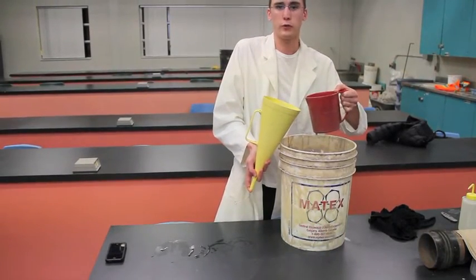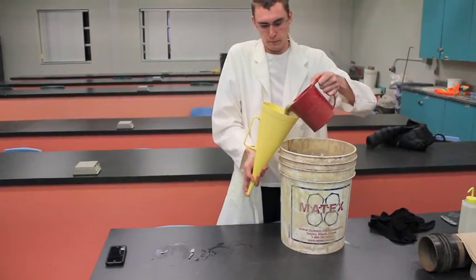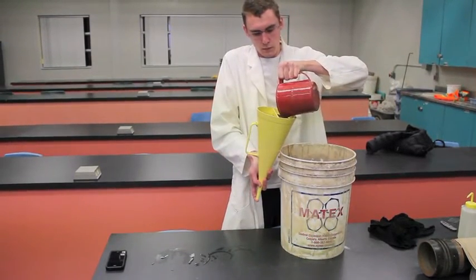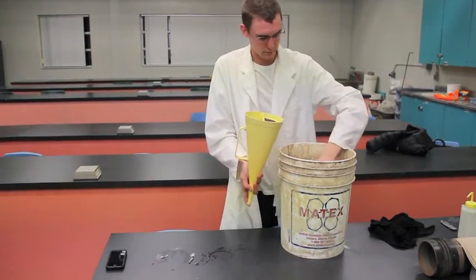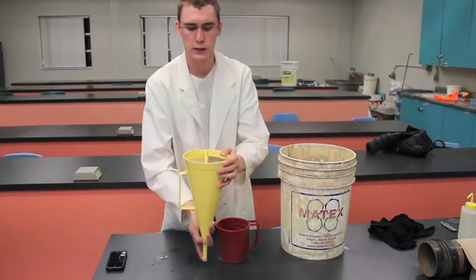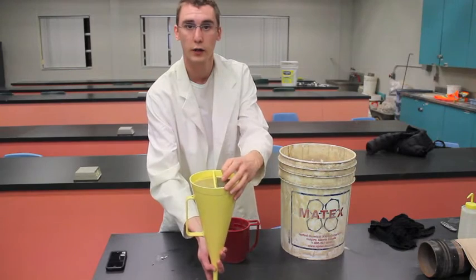Also, when you're filling it up, make sure you pour it through the screen. That's imperative to do. Almost there. As you can see, our mud is just right on that line, right underneath our screen.